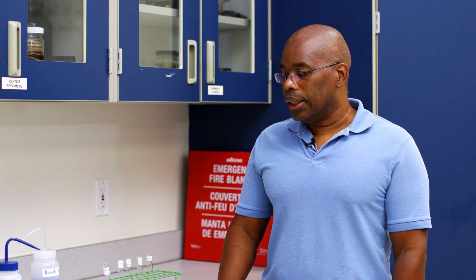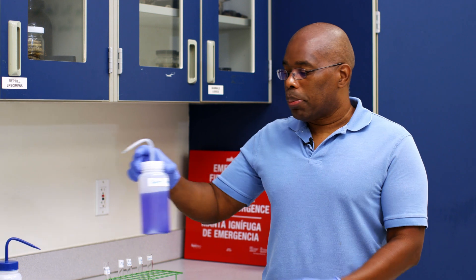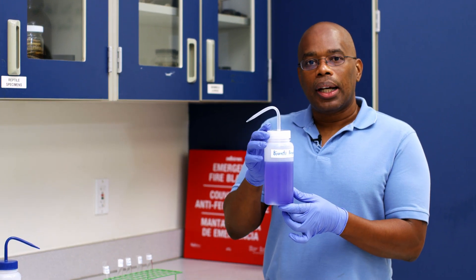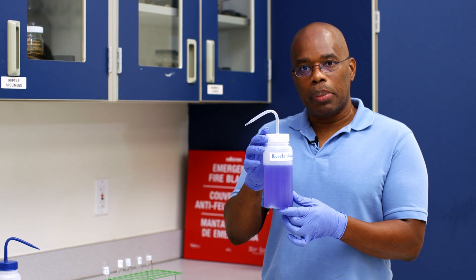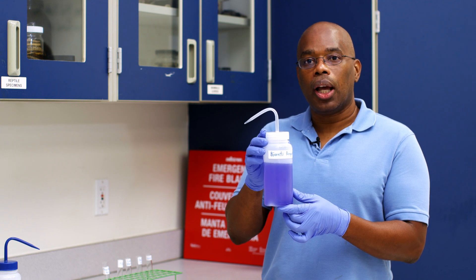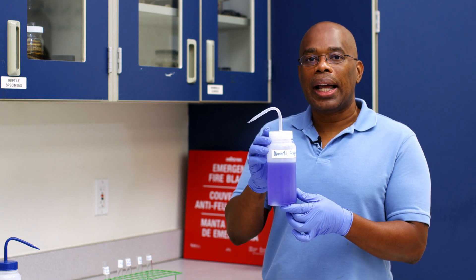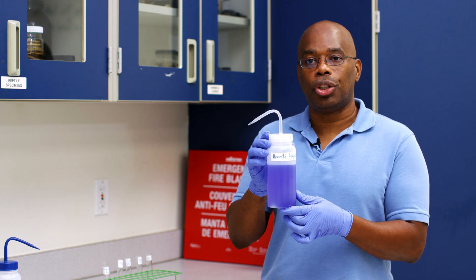Our last test is Biuret. Let's first talk a little bit about the Biuret reagent. Notice it has a similar blue color to what we saw with the Benedict's. Just as with the Benedict's, Biuret also has free copper ions, and we're going to use those ions to help us detect the presence of protein in solution.